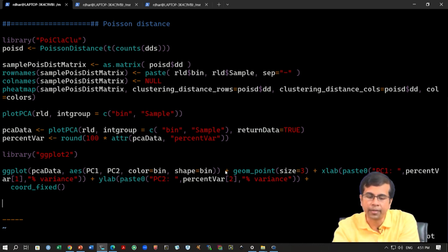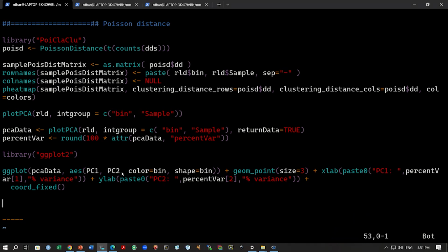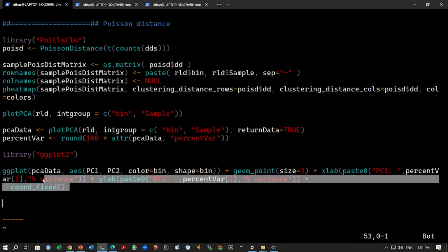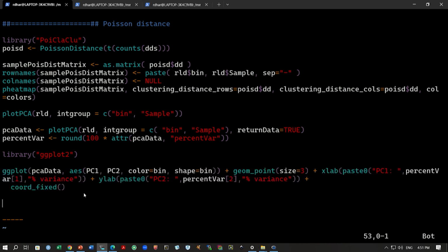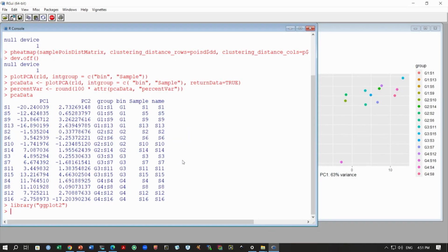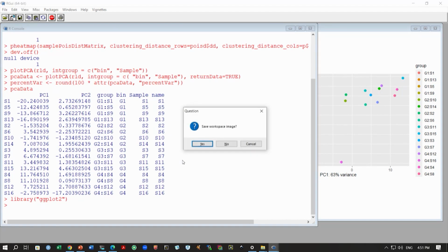So, we have this plus, and whatever you want to add, we just add with this plus sign. You can see this for all of them. If you have this geometry point, you have this x label, y label and so on, and of course you can add a lot more to this, and you learn that by exploring these functions. Okay, so we now run this command and see if we can get a nice PCA plot.